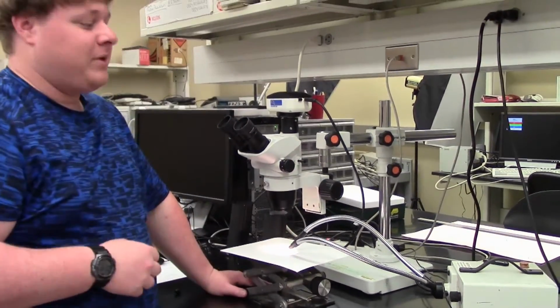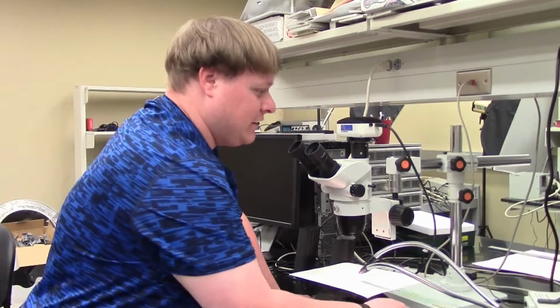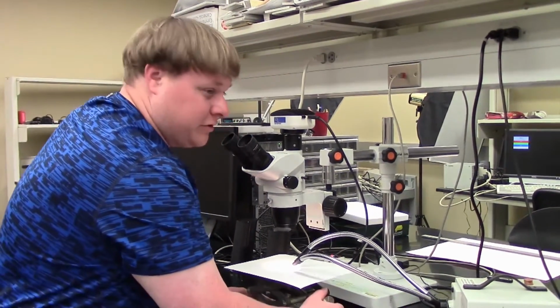If you need to, zoom in piece by piece, just to make sure that you don't lose track of where you're looking.